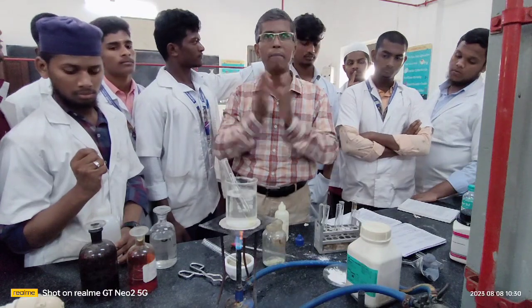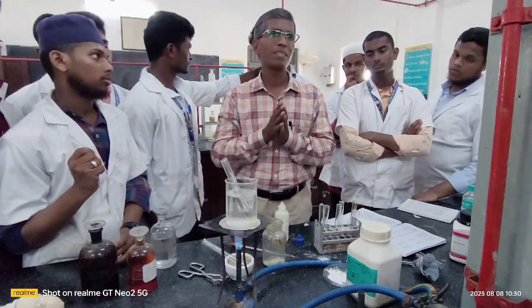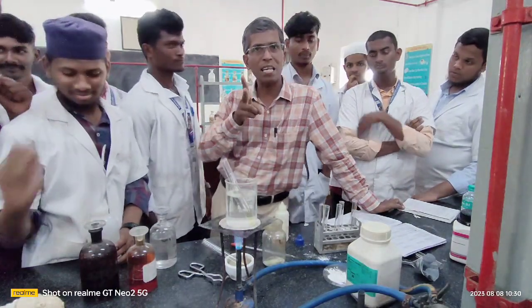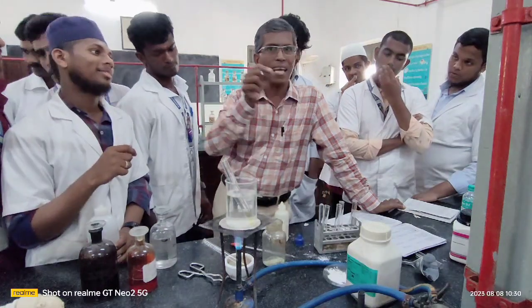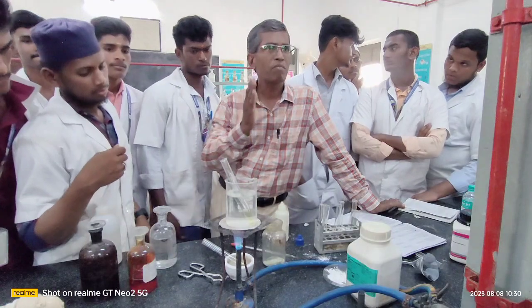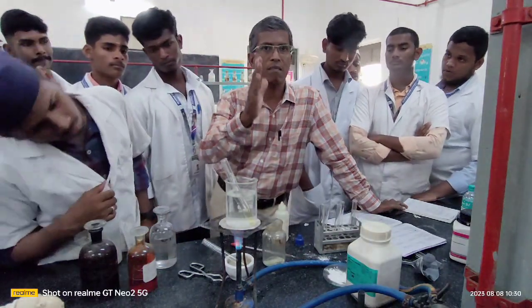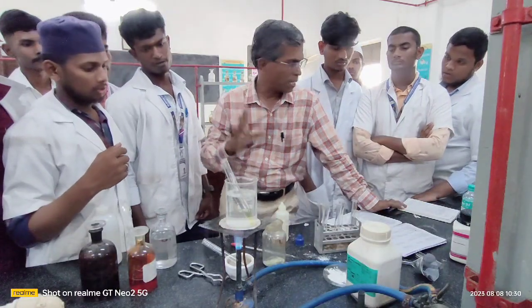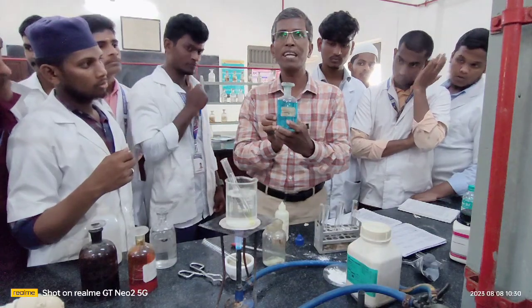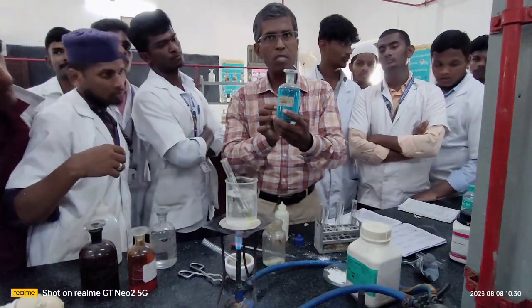Now, try to understand what is Fehling's solution A. I am using the technical name, the commercial name, the chemical name, Fehling's solution A and Fehling's solution B. Now, what is Fehling's solution A and B? Fehling's solution A is nothing but pure copper sulfate dissolved in water. Its color is, this is your Fehling's solution A, recently prepared, just now prepared.